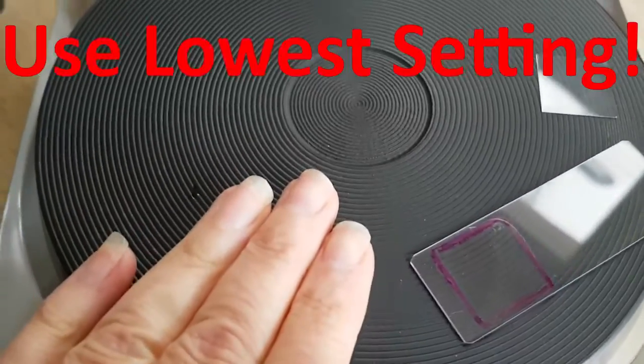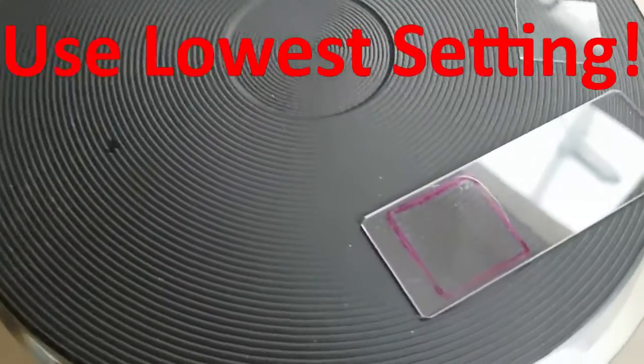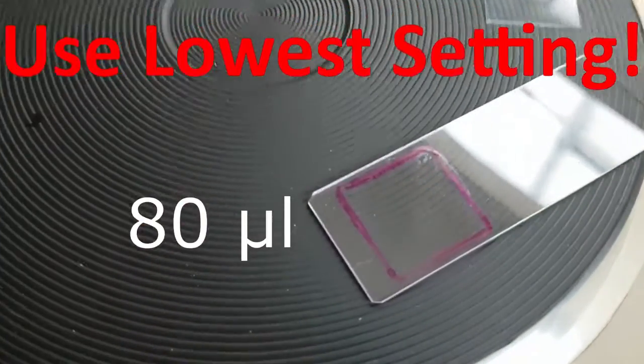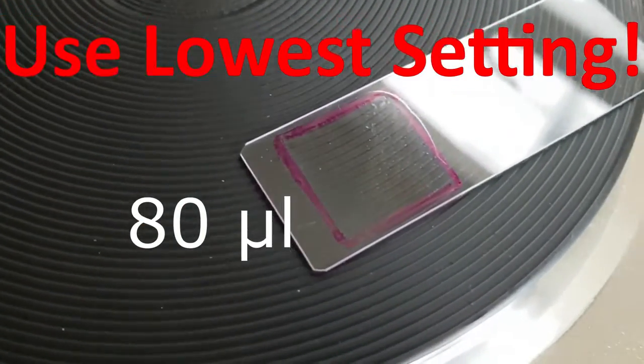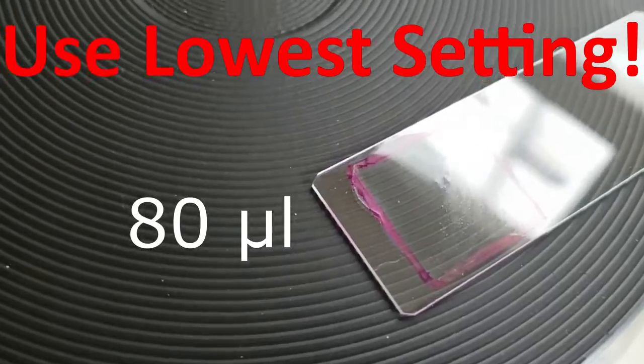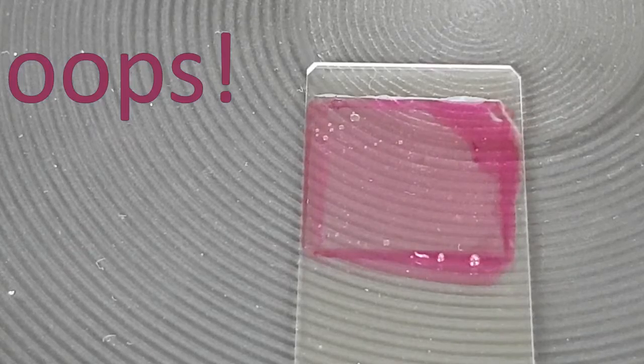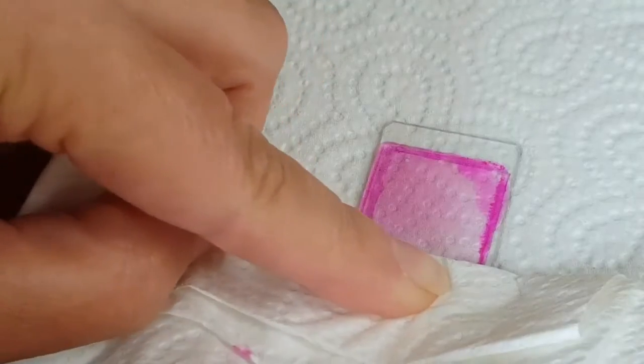I've got a little hot plate. It's just 40 degrees C. It's just drying out 80 microliters of the sediment out of the test tube. As you can see, I'll just put the cover slip over. It's not the best job in the world. I think that's as good as I can get it.